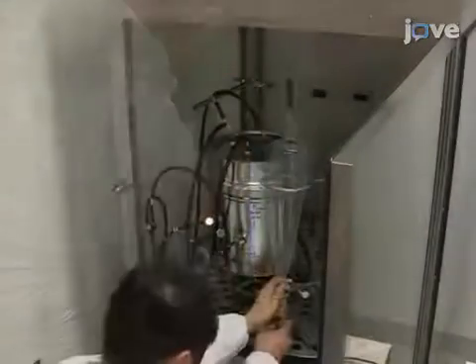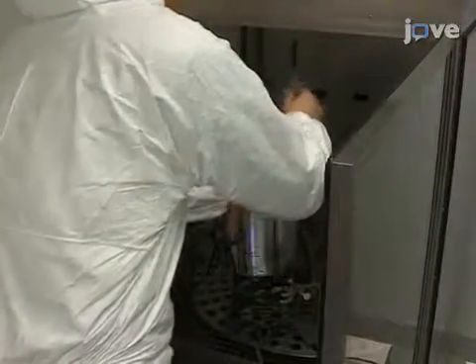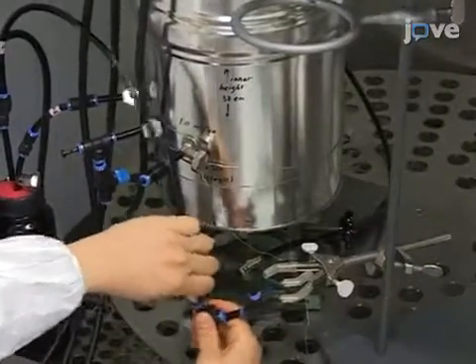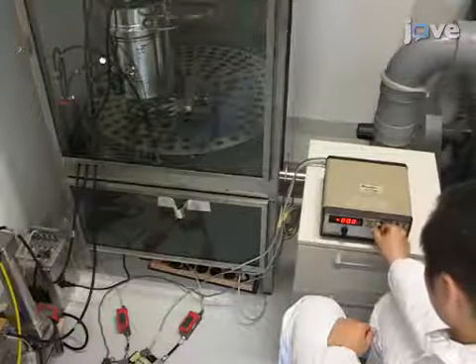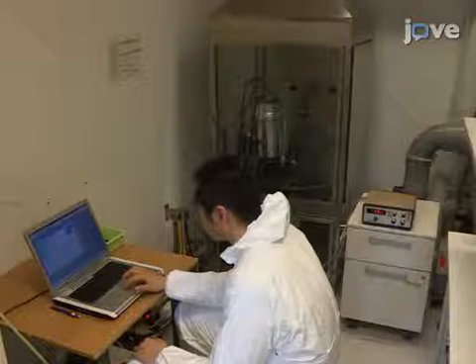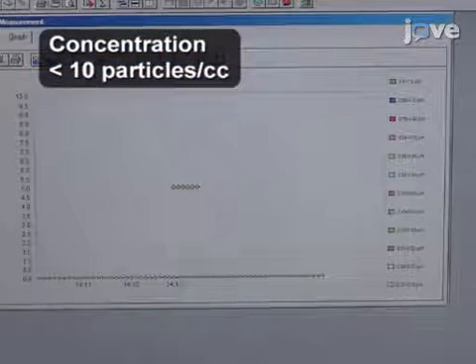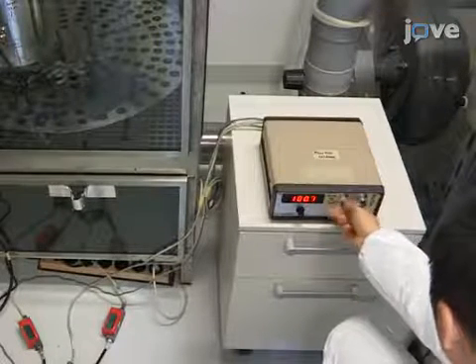Remove the aerosol generator from the setup to prepare the system for the experiment. Close the system by connecting the tubing that had been connected to the inlet and outlet of the aerosol generator. Then move to start the filtered dry air supply for the system. At the flow controller, slowly adjust the flow rate from 0 to 10 liters per minute and let it run. After at least 30 minutes, use the scanning mobility particle sizer to determine the concentration. If it is below 10 per cubic centimeter for three measurements, consider the environment clean and stop the airflow.